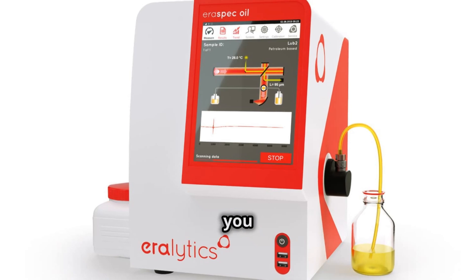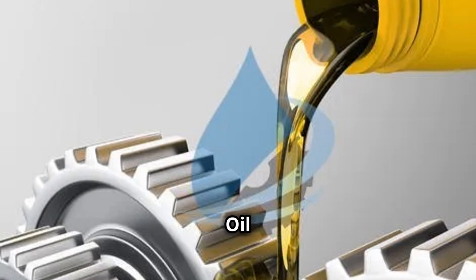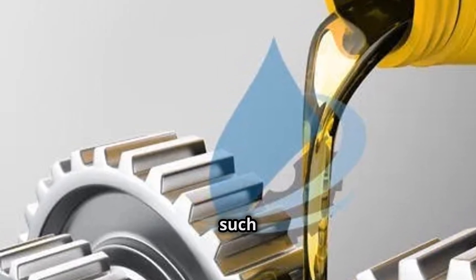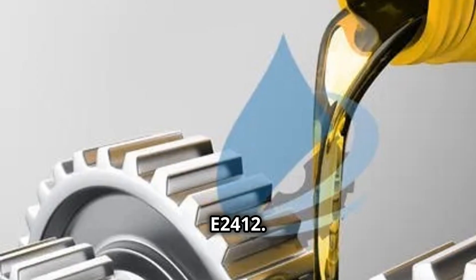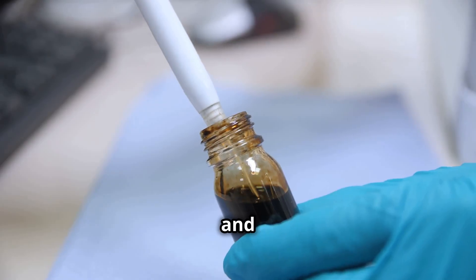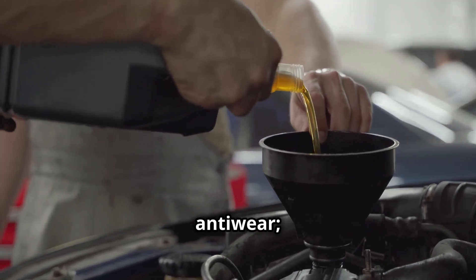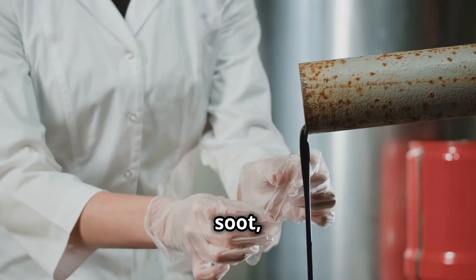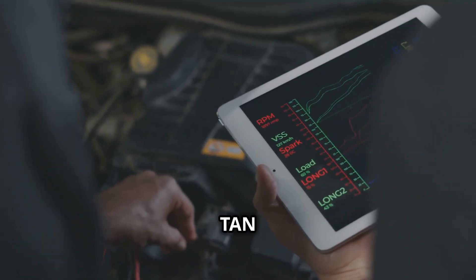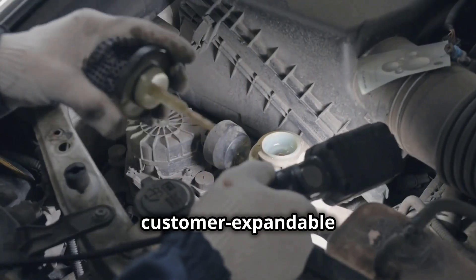Using the Eraspec Oil, you can monitor the condition of your lubricant to prevent the above causes from occurring. Eraspec Oil can determine parameters relevant in lubricant analysis according to the latest infrared standards such as ASTM-E2412. It monitors degradation products like oxidation, sulfation, and nitration; additive depletion like aminic and phenolic antioxidants and anti-wear; and contaminants like water, soot, fuel, FAME, and coolant liquid. Complex oil parameters such as TAN and TBN or viscosity are calculated by chemometrical models using a customer-expandable database.